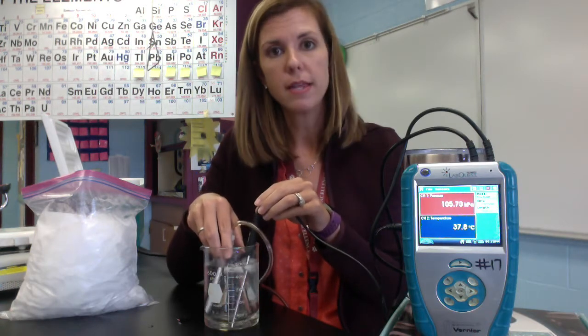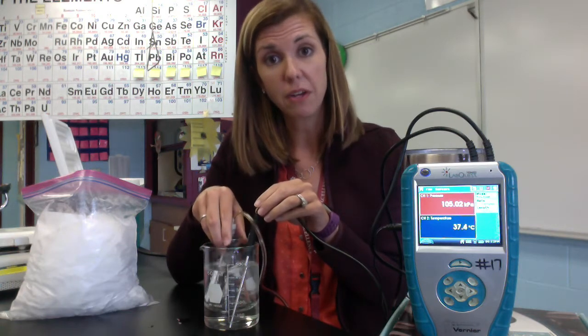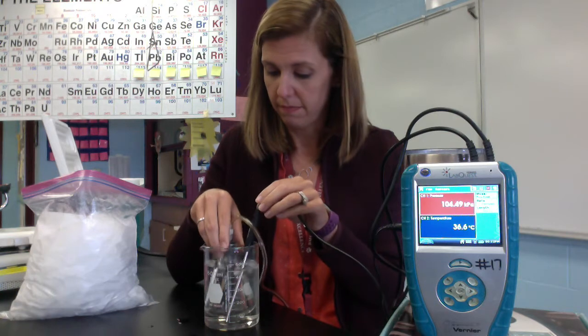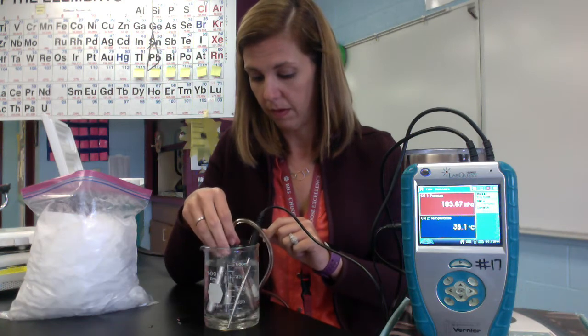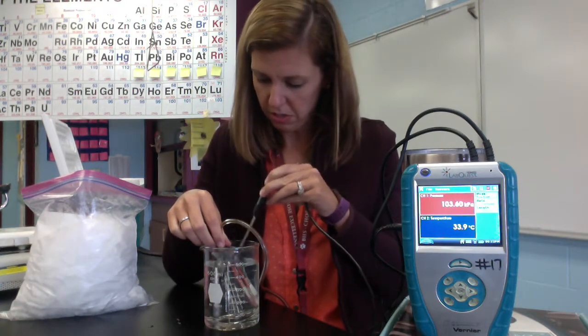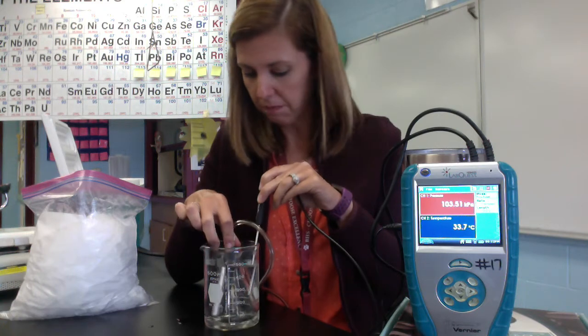A little shake in there, waiting for that ice to melt. It's a very exciting video this time. If you want to speed up this part, you totally can. There's still two little ice cubes, not knowing really what to do. Give them a little stir.